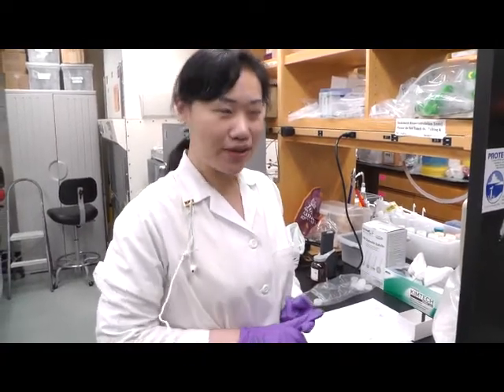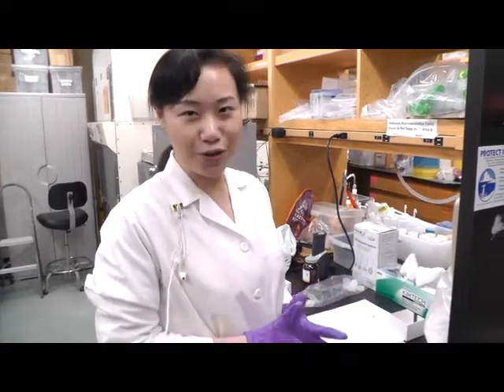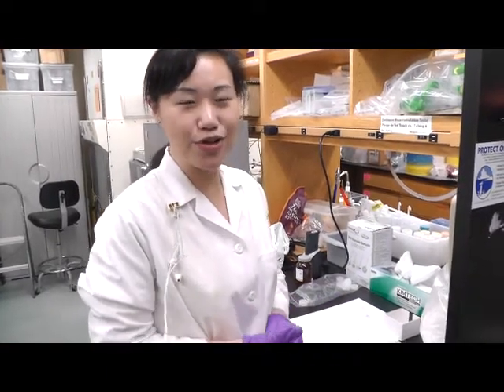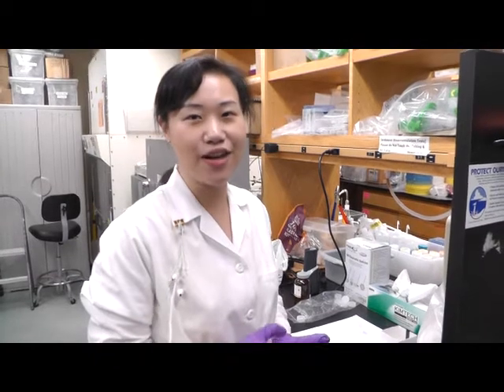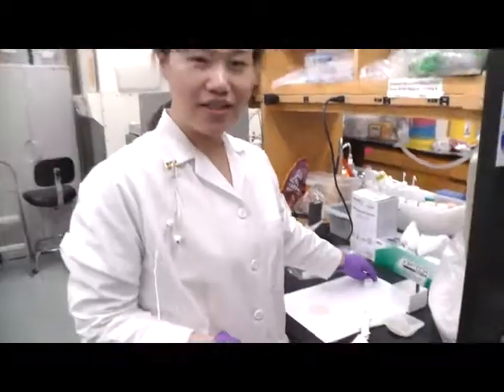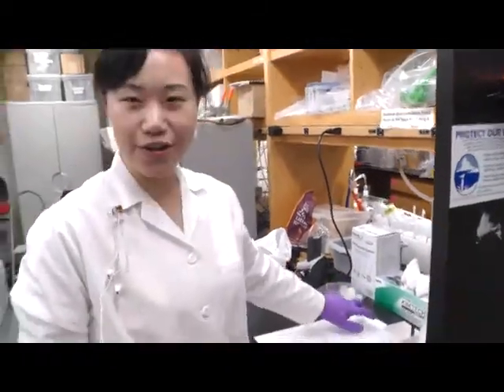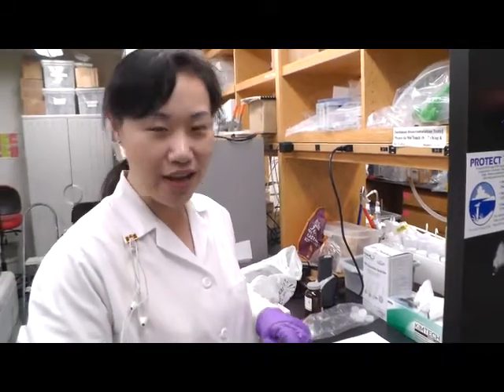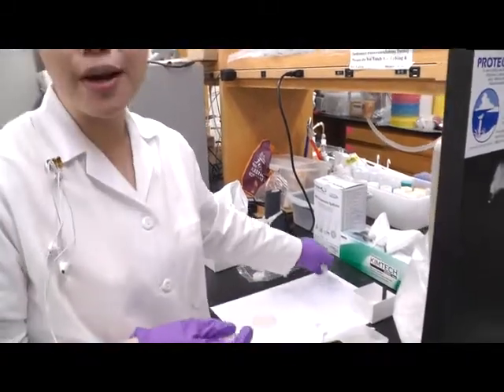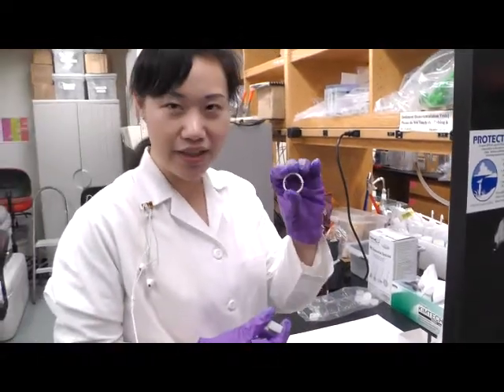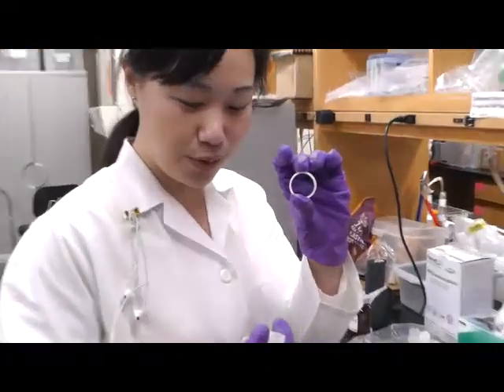We will show you how to make these cups and also show you how to shoot an XRF instrument. So the first thing I will show you is the components of an XRF cup. There are three components. We will need a ring, which will look like this one.